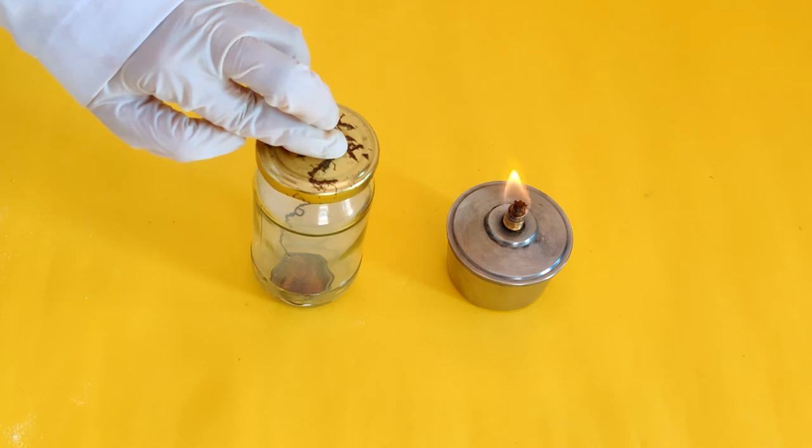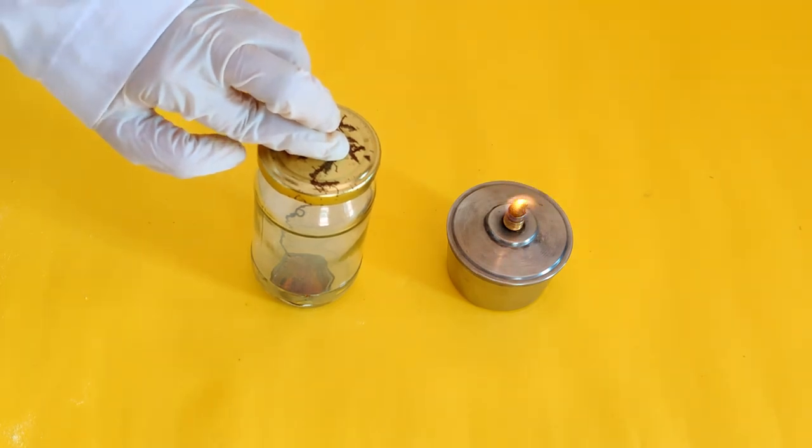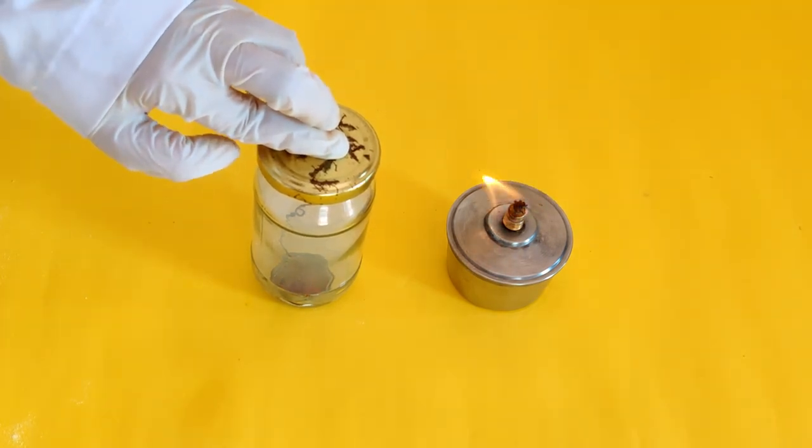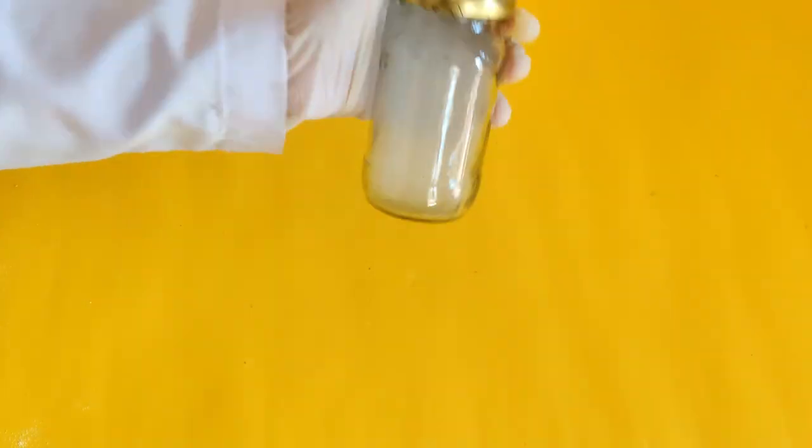Close the hole in the lid with your finger, so that the gas does not escape. Once the gas fills the jar, remove the cap setup and close the lid again.